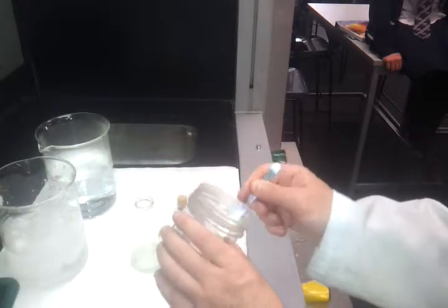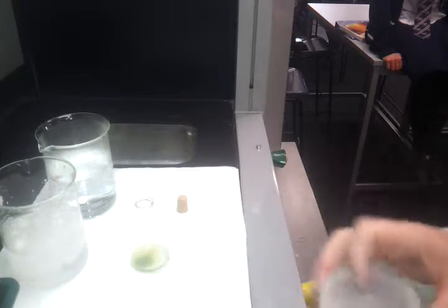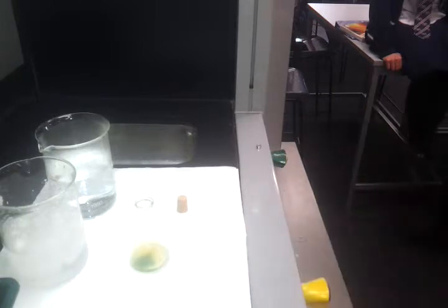You don't need a lot of copper to do this. And if we look in there, it's going a bit of a brown colour. The reason we're doing this in a fume cupboard is that the gas is really poisonous, so we don't really want a lot of it in our lungs. I'm going to put a lid on that so that I can turn the fan off.